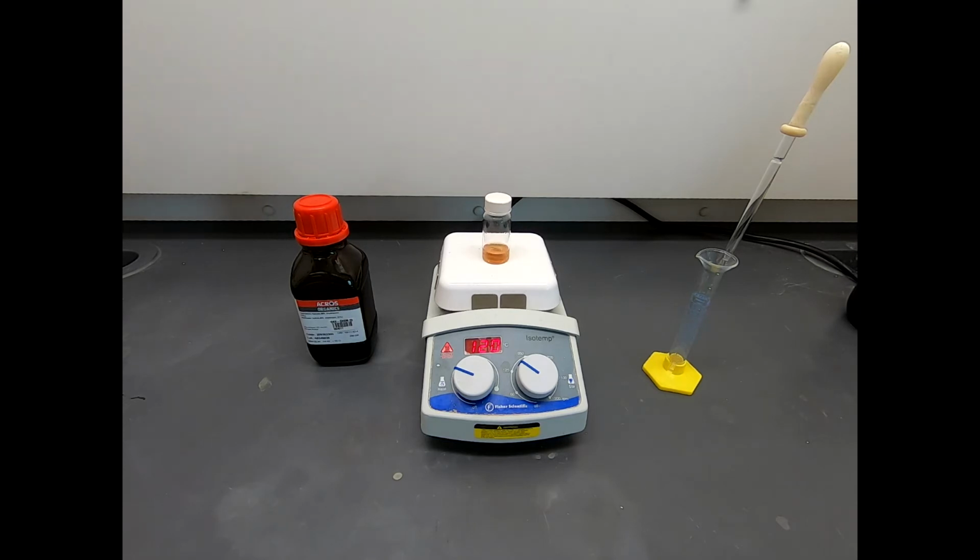So, okay, well, what is the next plan? Enough talk about what we're seeing. What are we going to do? Before the reaction is complete, we really ought to have a check and see if it's complete, and we'll do that with a TLC. So I'm going to go off camera, I'm going to take a TLC, and we'll look at those results.